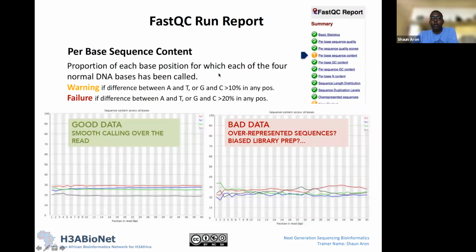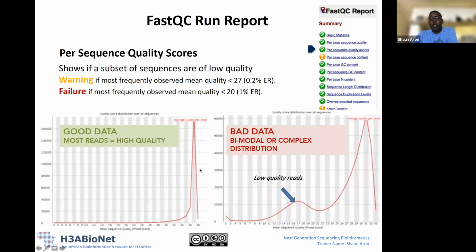See, there's a question. So the sudden peak at the end of the graph is what we expect. Sorry, I'm going forward. Remember, these are two different data sets. This is an example of a good data set. In a good data set, we expect to see this one peak where a majority of our reads, here 160,000 of our reads, have a mean sequence quality score of between, say, 36 and 38. So usually we only expect to see one peak, okay? In this instance, we would expect to see this one peak here at the end.